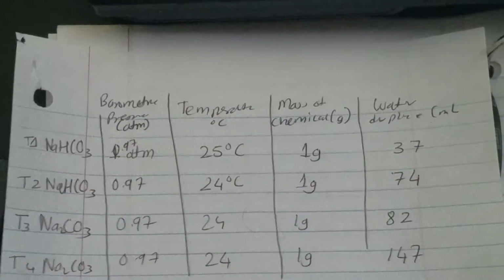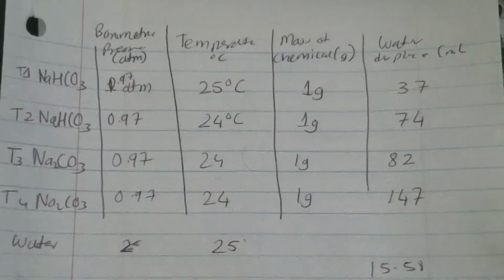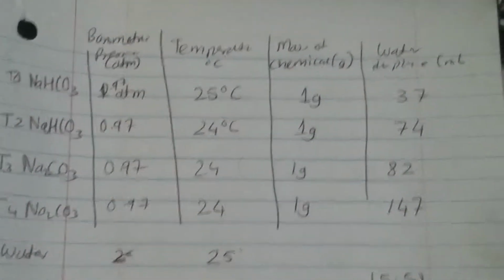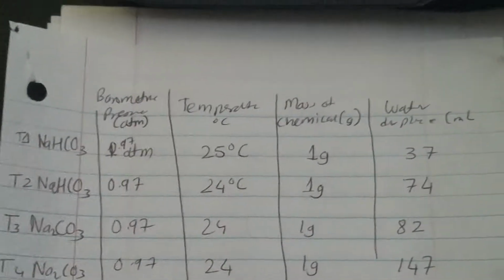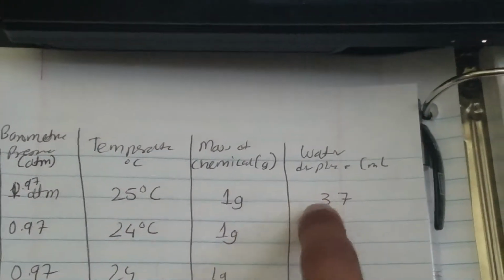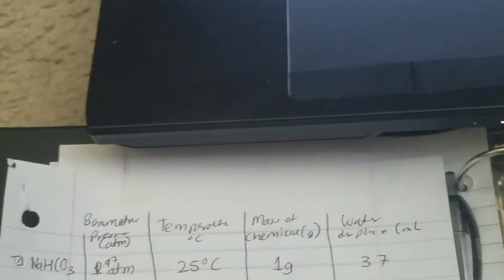So I see there is a huge displacement difference between these trials. Partly the reason is that the first time I did the experiment, the 6-inch rigid tube was submerged in the water, but not submerged enough for all the gases to actually displace the water.